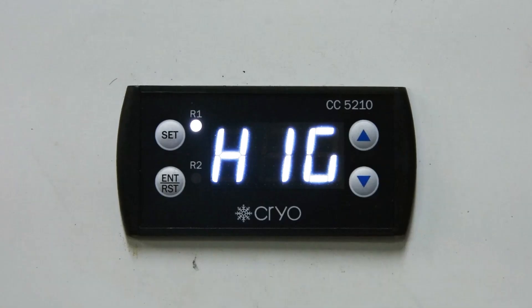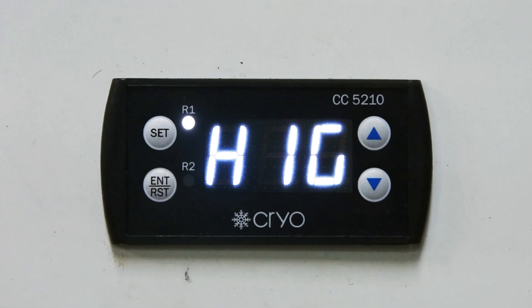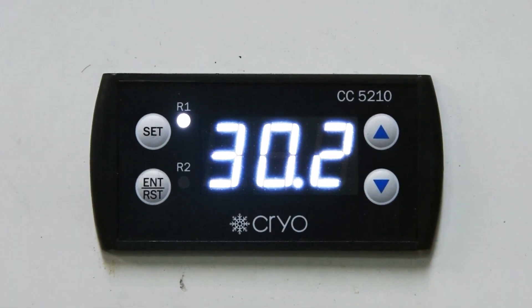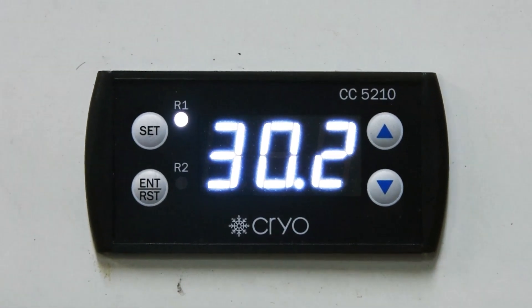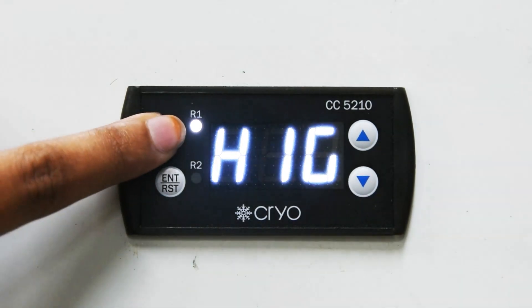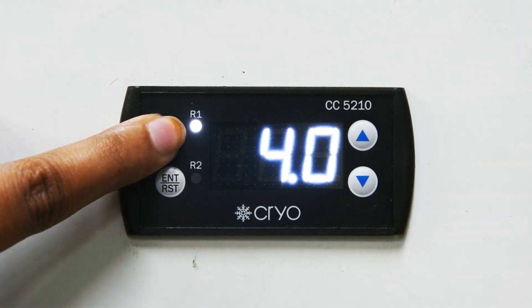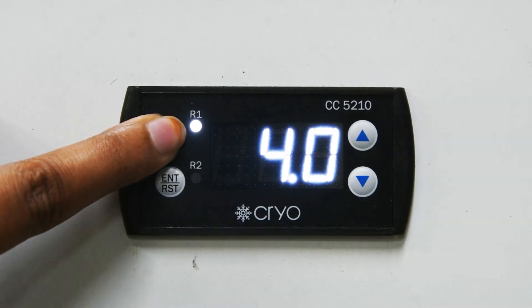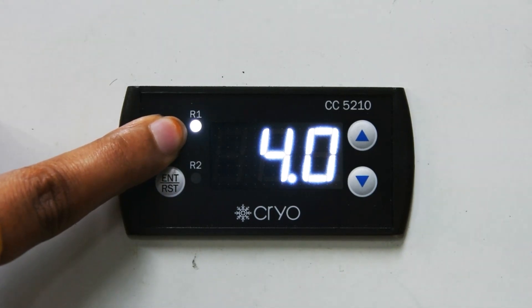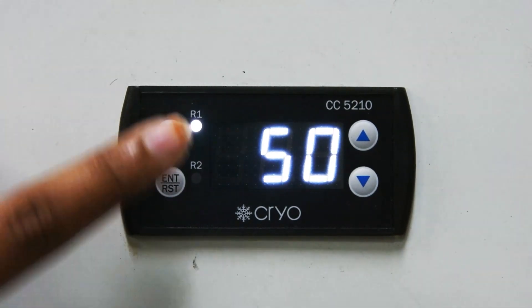We will see how to check the internal set parameters. To check internal set parameters, continuously press the Set button for 5 seconds. Once pressed, it will show P50, which is the password setting.